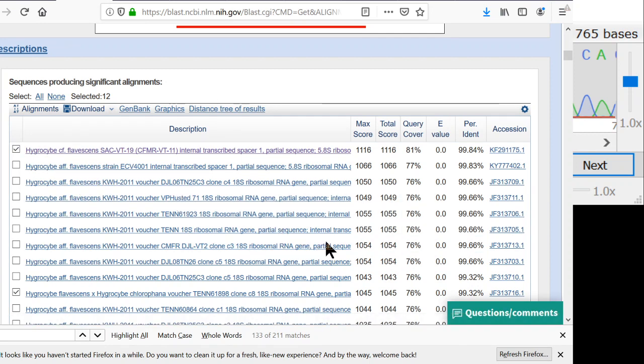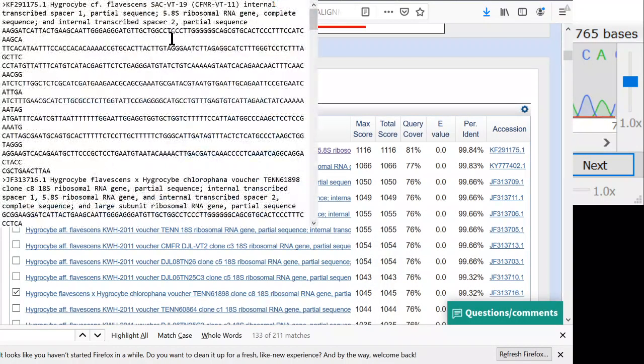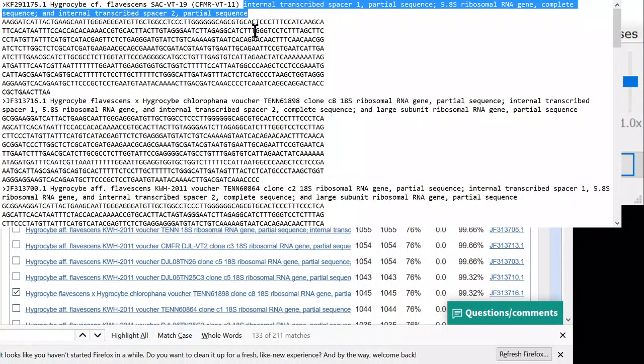And we will open it with Notepad. And I got to go over here, and we have the Notepad shared. Okay, cool. So here's the FASTA. And you can see that when you get a FASTA from GenBank, it's got a really long name in here, and a lot of the stuff isn't needed. You can trim out the name of the gene because we know this is all the same gene anyway.